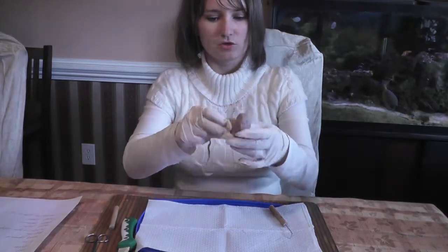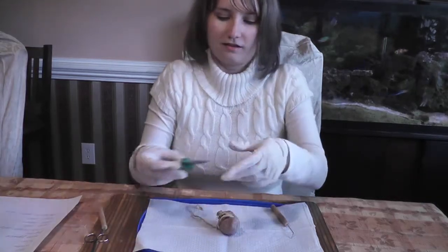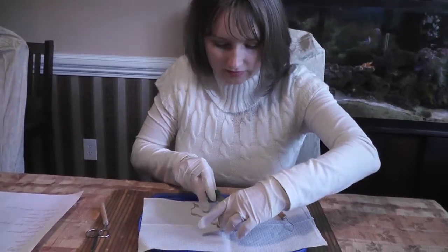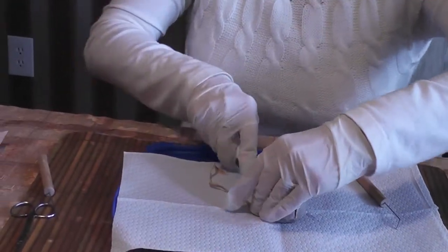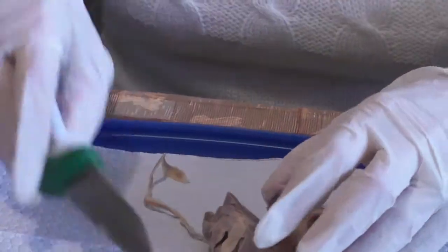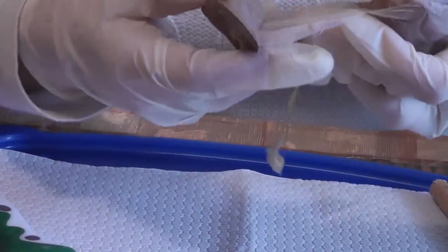So now I'm gonna go ahead and make a longitudinal cut. So can you please zoom in? I'm going to go ahead and try to cut this in half longitudinally. Uh-oh. We gotta point down more. Or just fix it while I'm cutting. Okay, so here you can really see the renal capsule. Let me just take it off. This is the renal capsule.